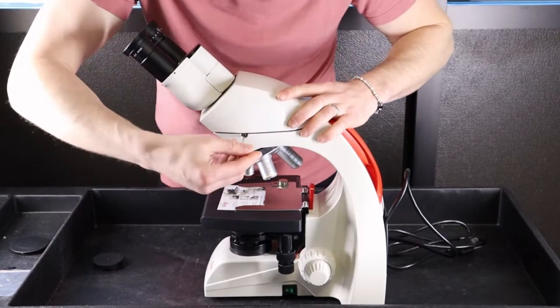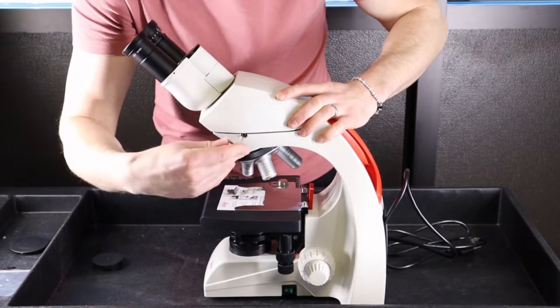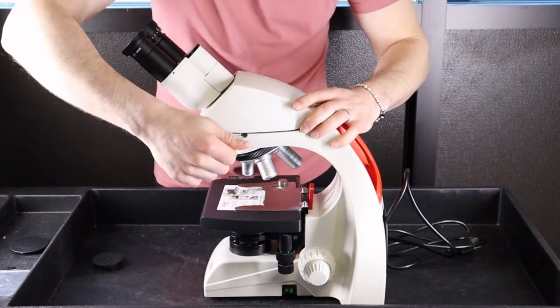While you're holding onto it, you're going to tighten that Allen key up until the head is snug and in place.